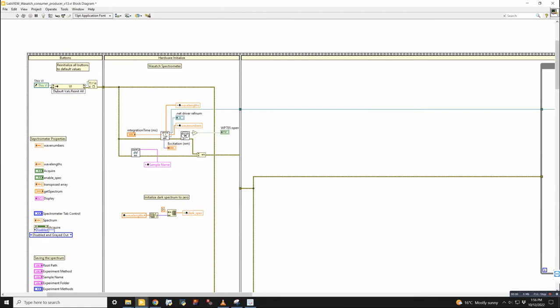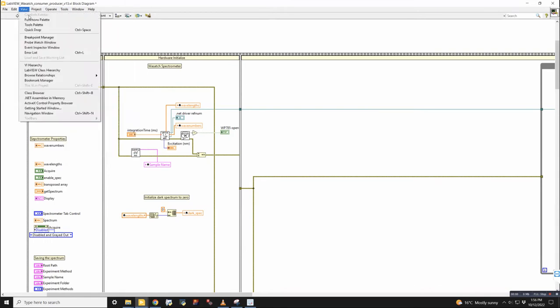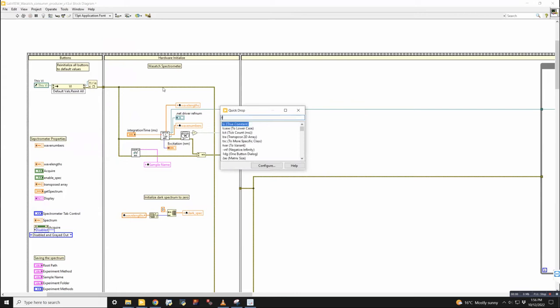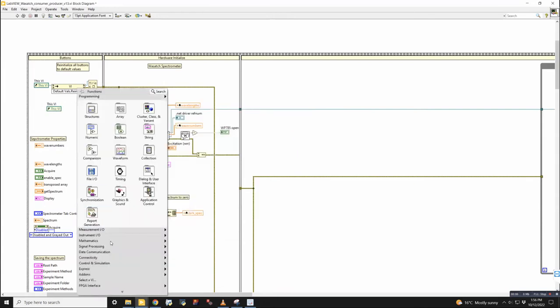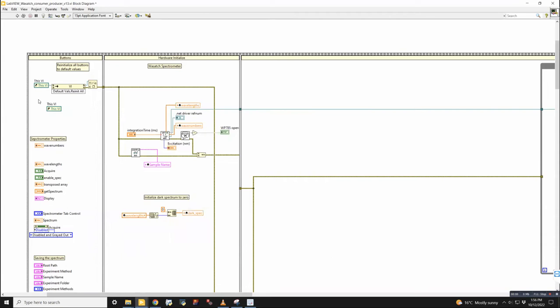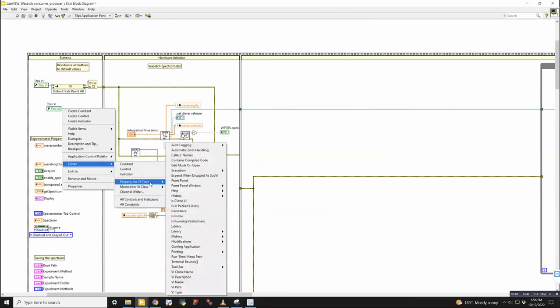Which one is a property node? Oh, yeah, so a property node is this thing. Okay. So you could go to the view quick drop palette, and then probably type in this VI, and it will drop that. But I don't know where in the menus to find it. I went through the menu and never found it. Okay. So then I can probably go like this and go to create property for VI class where it says default, or somewhere here. I actually don't even see it.